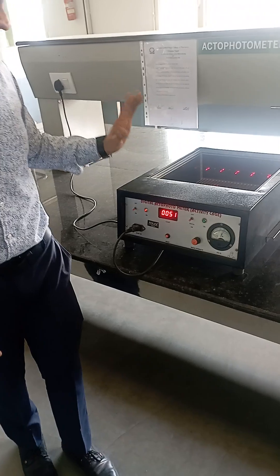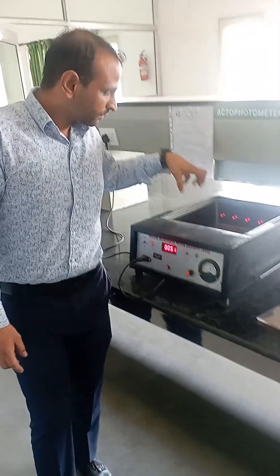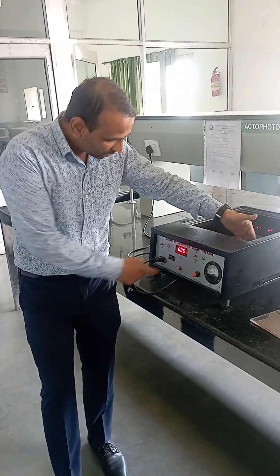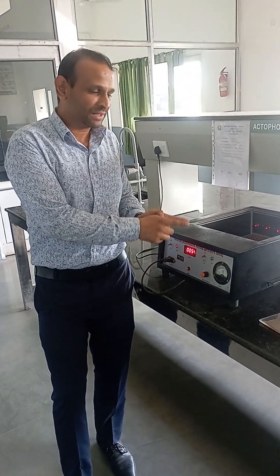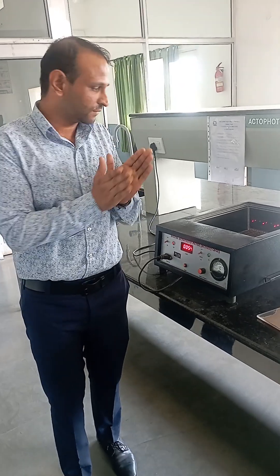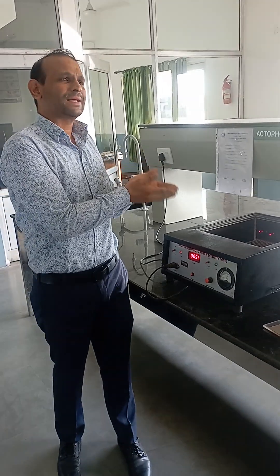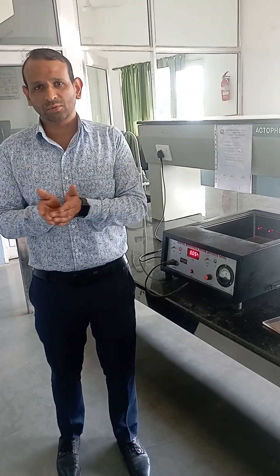If the animal is anxious, once placed, it will start moving quickly and a greater number of crossings will be recorded — this reflects that the animal is in an anxious state. This is what we observe in the control group animals.